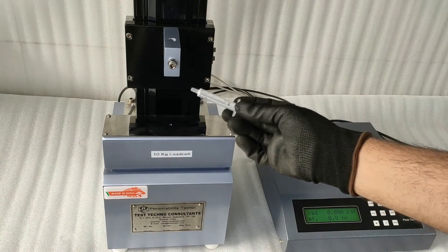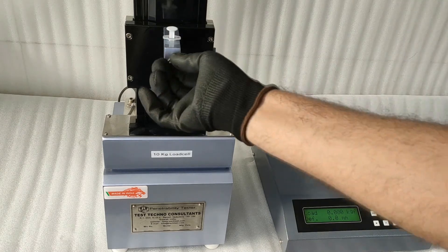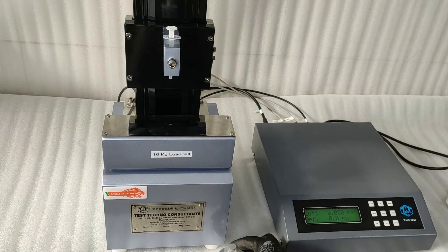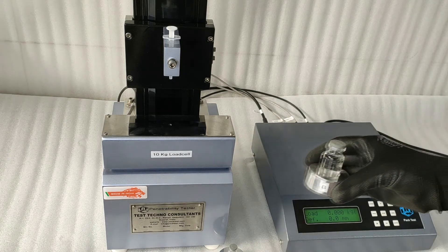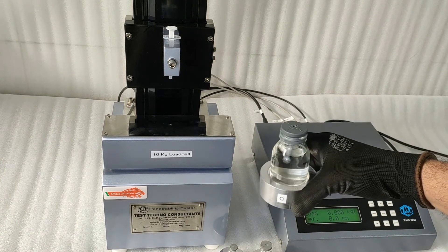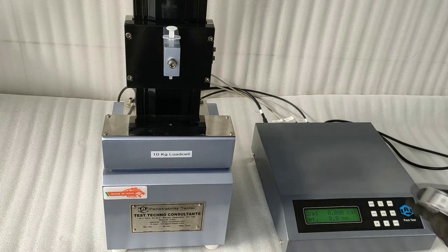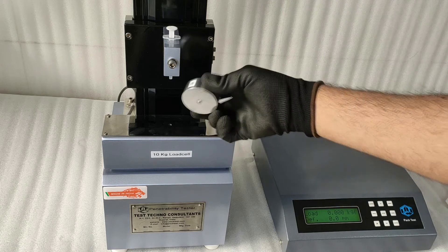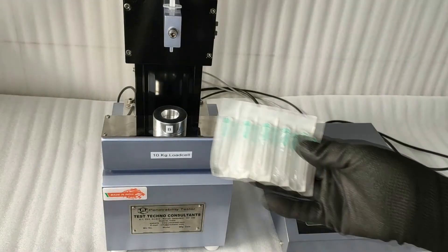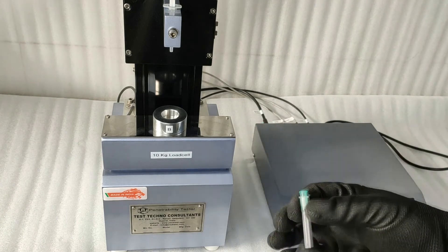Position the syringe as shown in the video. Three vial holders will be provided as seen in the video. For the purpose of this video, we will use vial holder B. Fix the needle onto the syringe as guided.